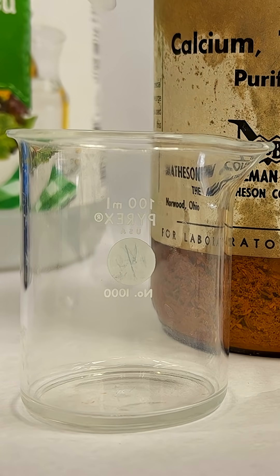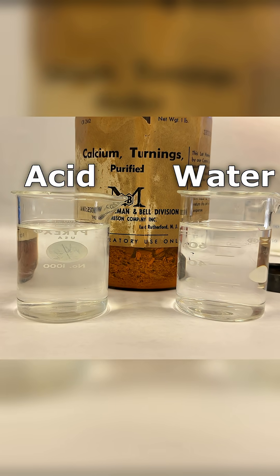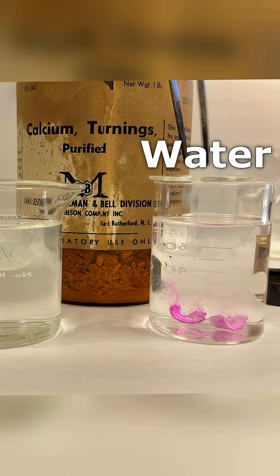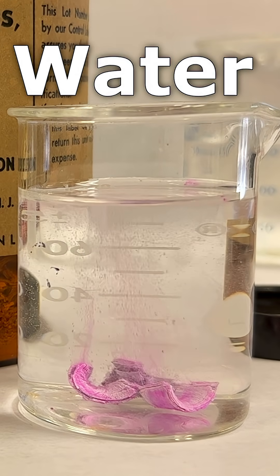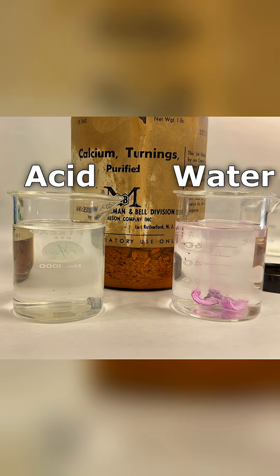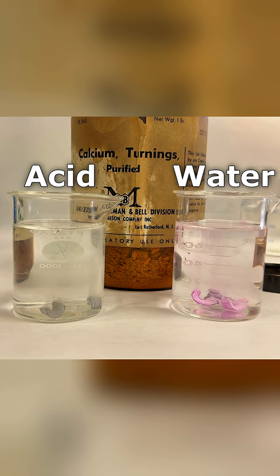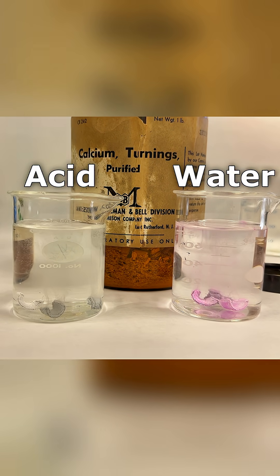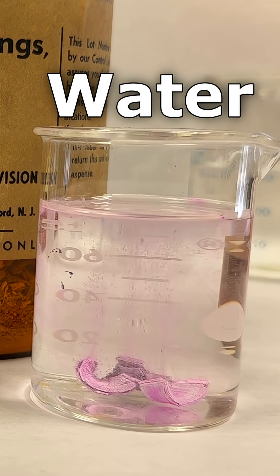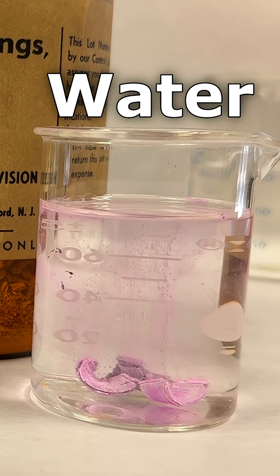Now this one, we're going to put some acid in. Putting the acid in, we see nothing happens. I'll put three in there, so you can see those starting to react. Now let me drop some in here and you can compare the reaction rate. Who's making bubbles faster? We see some bubbles going — it looks fairly even right now to me.